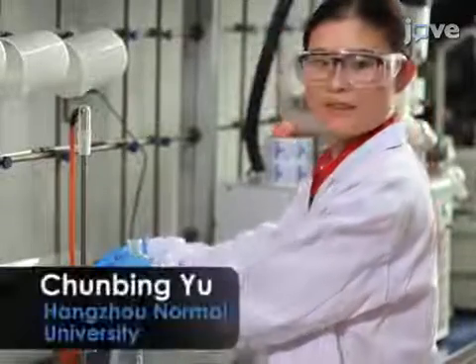The main advantage of this technique is that Z,E-butadiene can be obtained directly from acrylamide and allyl acetate without any oxidant using an inexpensive ruthenium catalyst. Demonstrating the procedure will be Chunbing Yu, a graduate student in our laboratory.